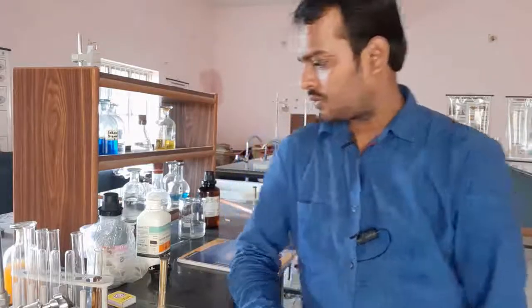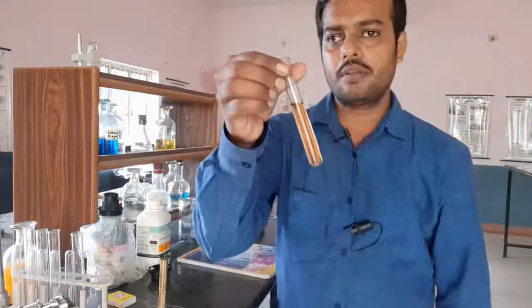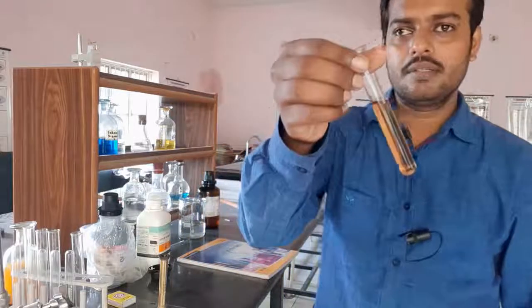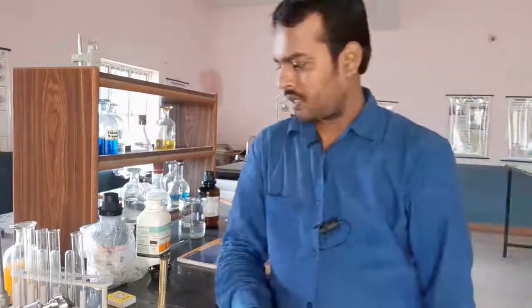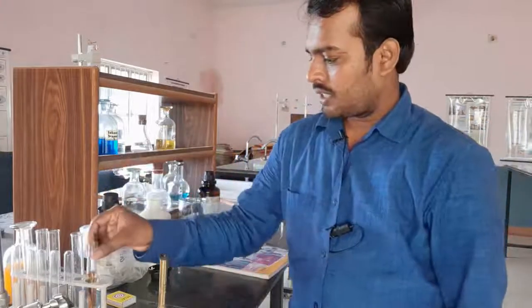How will we detect whether the given sample is phenol or not? We have a small quantity of sample — you can see it is an oily looking substance.